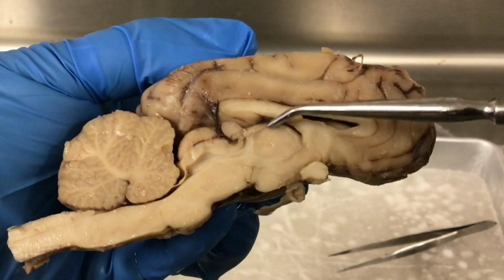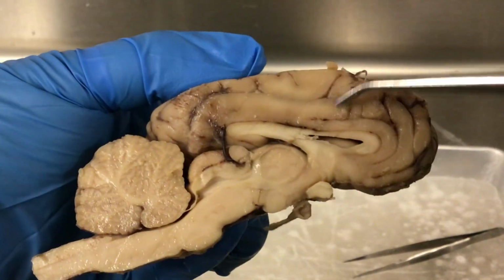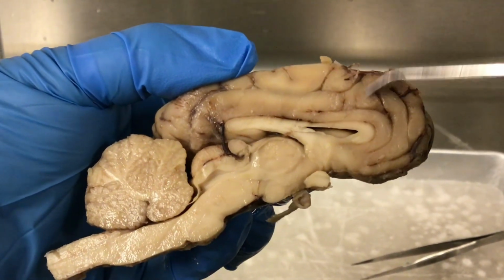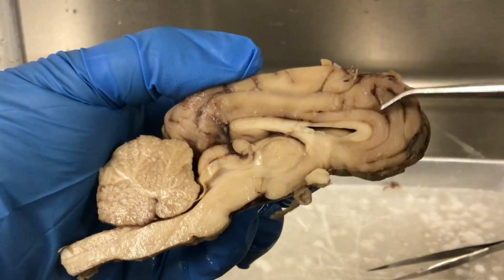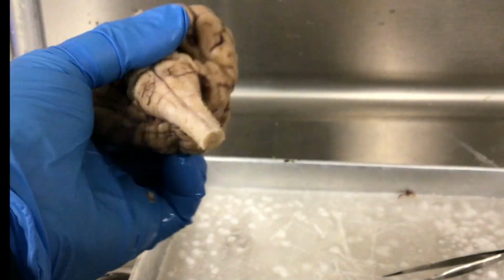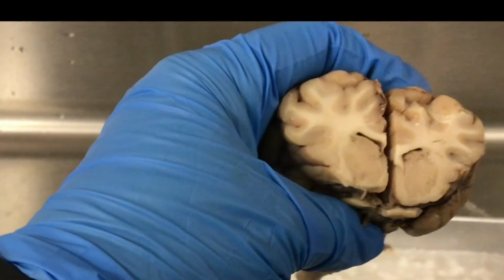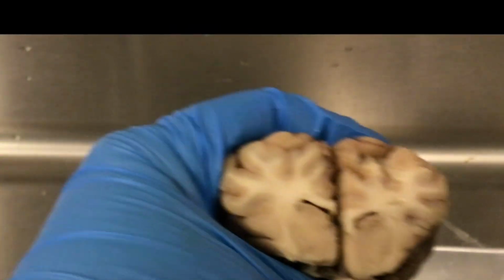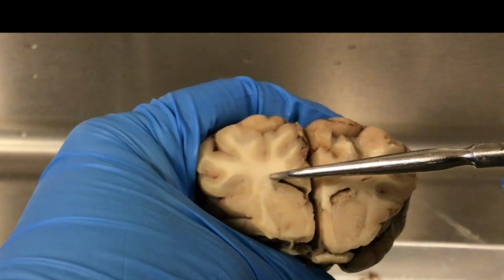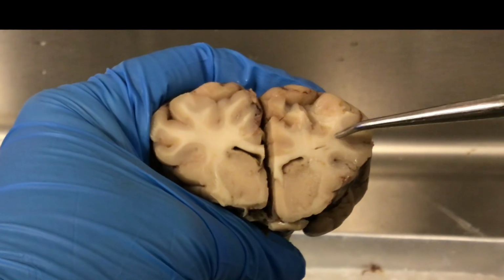One other thing, okay, so you see the white matter here, okay? You see the white matter in the cerebellum, but I'm going to show you a frontal cut of the cerebrum to show you some differences between the gray and the white matter in the cerebrum. The gray matter, remember, unmyelinated axons and cell bodies make up the gray matter of the brain. So here is a frontal section, and you can really see the white matter, and white matter is going to be myelinated axons. So you can really see the separation of the gray and the white matter in the cerebrum.